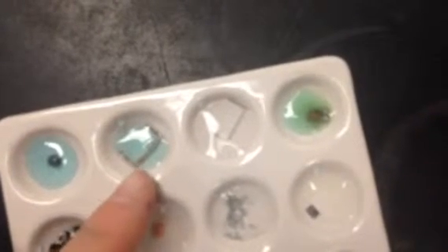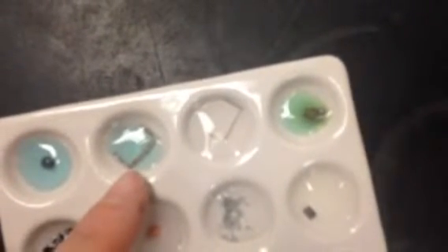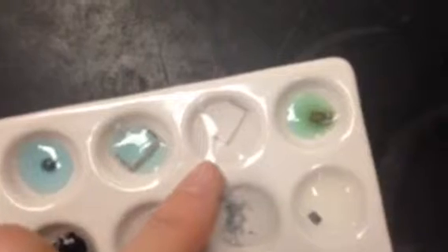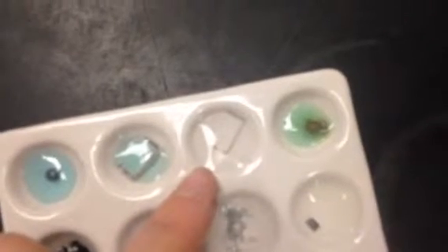So notice it is getting kind of caked from being a silver color to being a reddish color, which is amazing because it's reacting with copper. So that should make a lot of sense what we see. This one, I don't see any change. Again, there's a clear colorless solution, and then I still see that silver staple. Again, it's probably hard to detect on the screen, but you'll have to trust me that there does not appear to be anything happening in there.